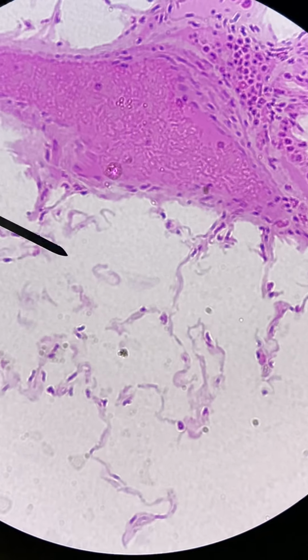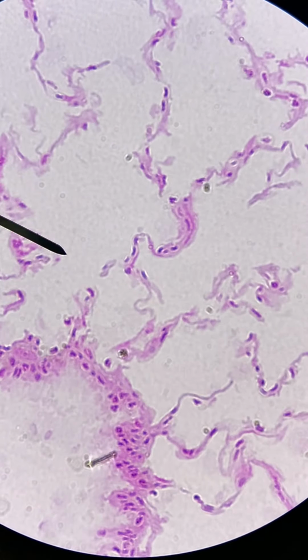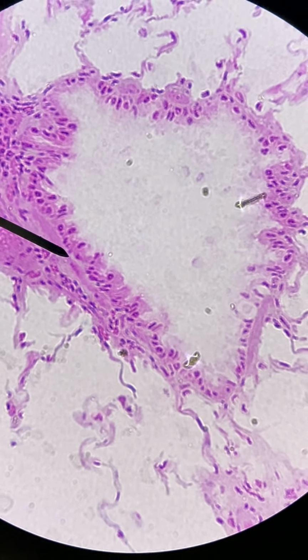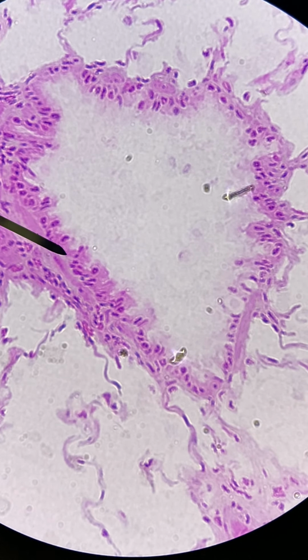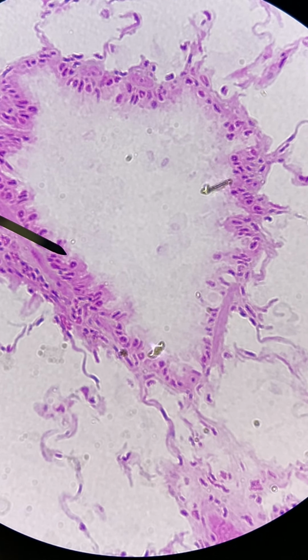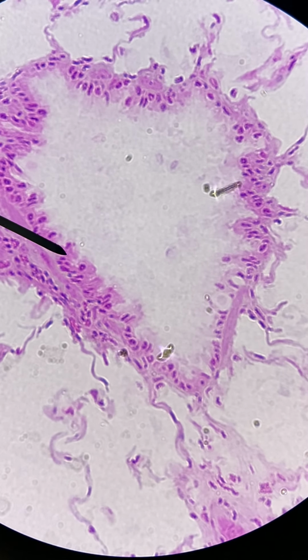I'm going to go up here where I know there's a bronchiole, and that is right over here. So this is a bronchiole. That tissue on the inside that lines it, where the pointer is now, isn't a really awesome representation of it, but this is pseudostratified ciliated columnar epithelium, just like you'd have in your trachea. And you can tell that the bronchioles have a much thicker wall than the alveoli do. So when you're looking at that, look for that.